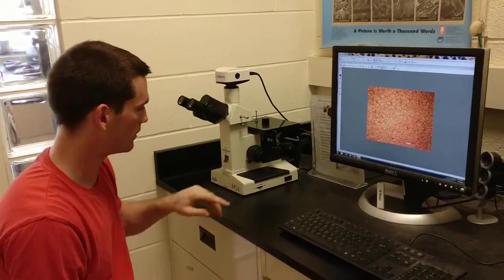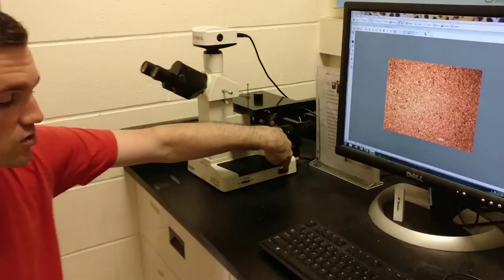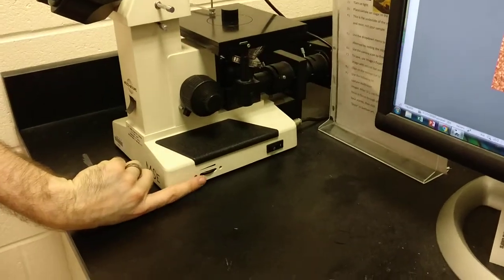We're ready to image our sample. We have the power switch of the microscope here. We have a light adjustment here.